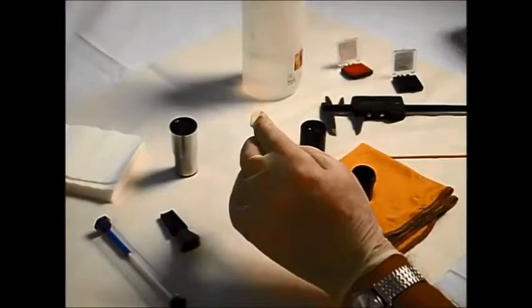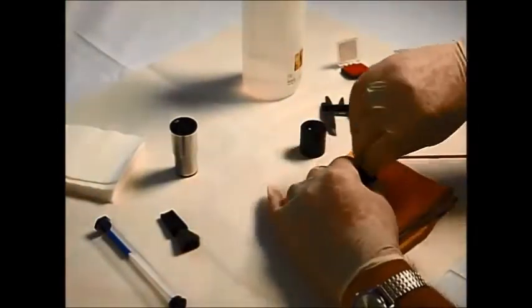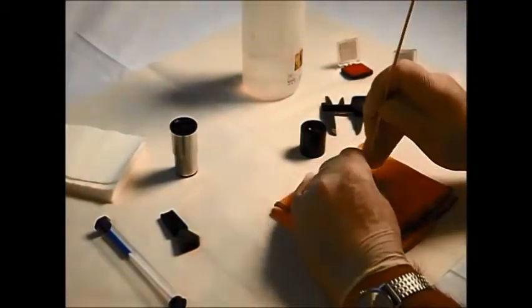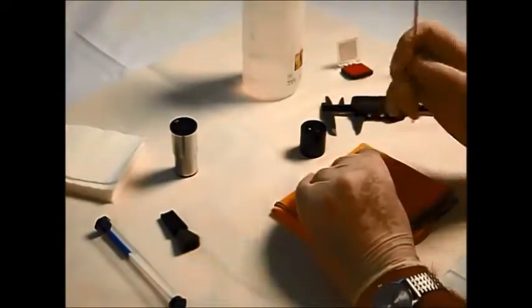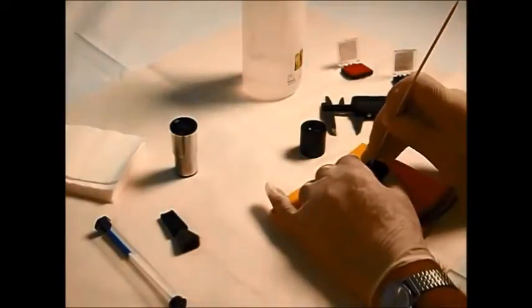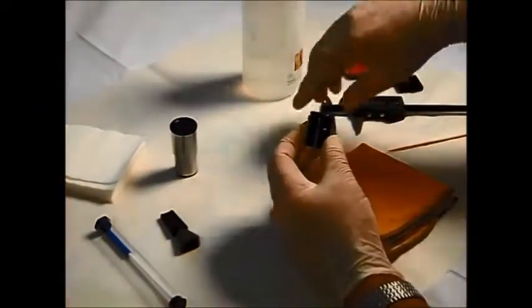Again, as you saw on the last one, we're going to use a circlip to hold this one in place. This one's actually a circlip with a pointer, but I probably wouldn't use a pointer one normally, but there we go. So a circlip in here. It's the downside, of course, of using gloves. It can be a bit awkward. It's far harder with marigolds.